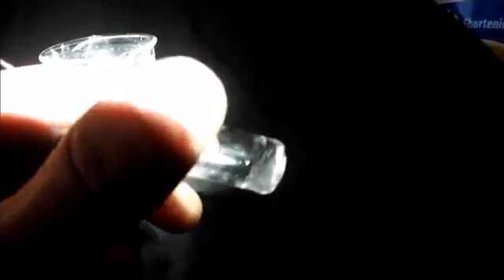It's time to melt it again and get a little ice cube out to see if it sinks in pure water. Okay, so there's the frozen water right there — let's see if I can break that out without losing it. There's half the frozen water drop. I'll drop it in the water and see what it does. Oh my gosh, it sinks! Can you see it? I've got one more — let's drop it in. And it sank. I can reach in there and pick it back out. It's holding together in the ice water. I've got an ice cube in there just to keep the water cold. And it sinks again.